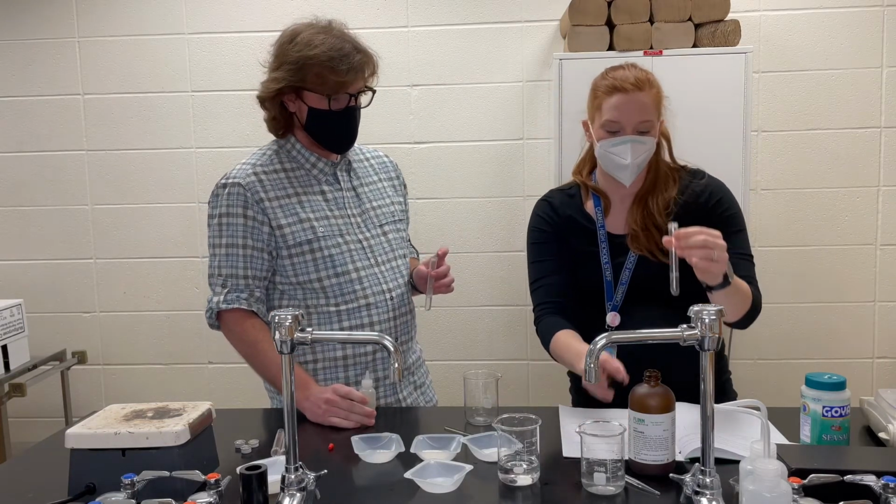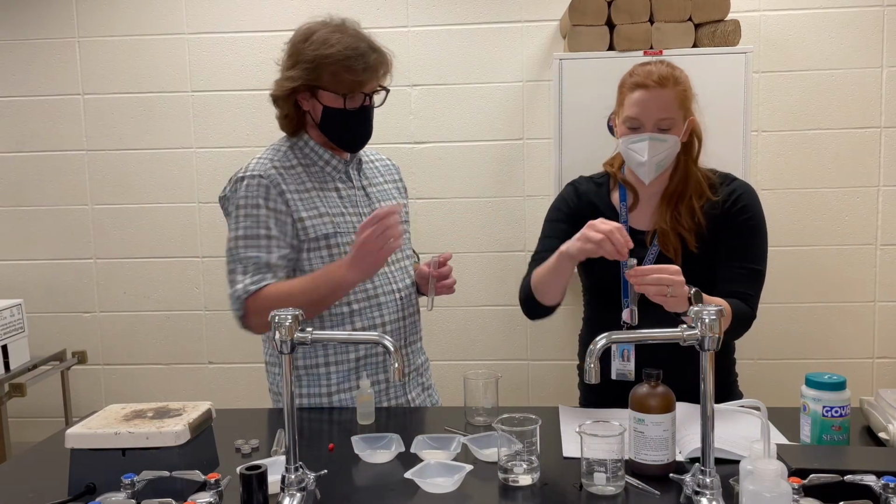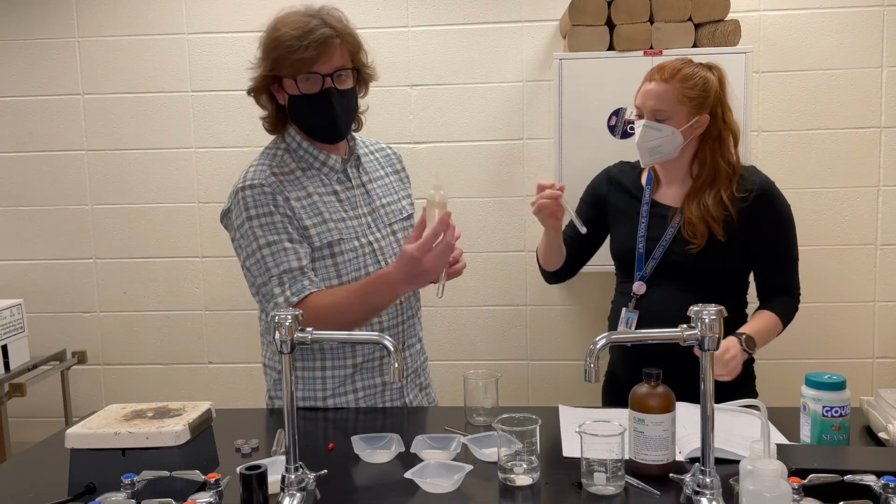While I measure mine, you could put a cap on, mix it up, and see what happens. Great. I've got another idea. 10 milliliters of water, and then I have ethanol.